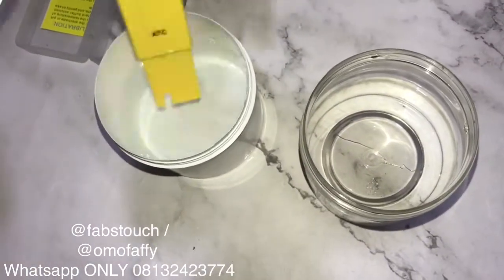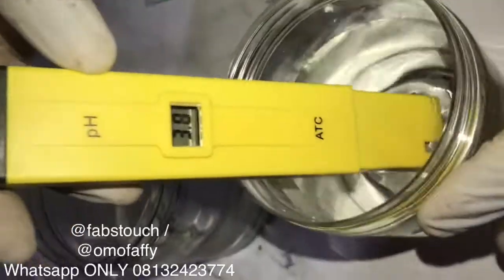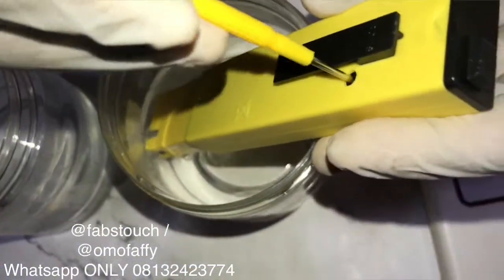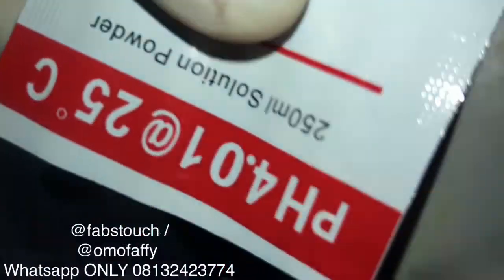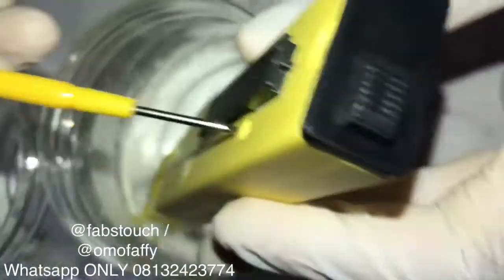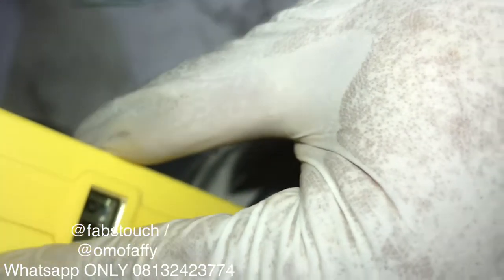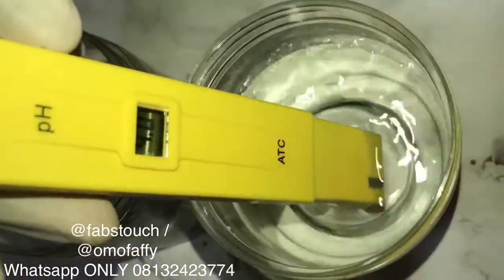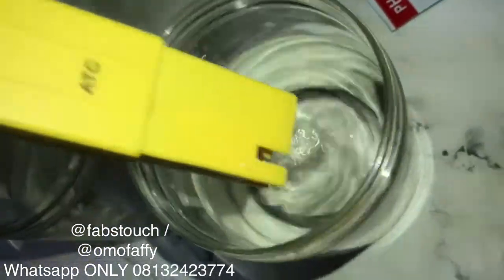After washing off, dip your meter into the second solution — the one containing buffer powder pH 4.01 — and repeat the same process: turn your screw until you get the exact figure on the buffer powder, which in this case is 4.01. Please don't forget that I dissolved my buffer powder in 250ml of distilled water before going through this process.